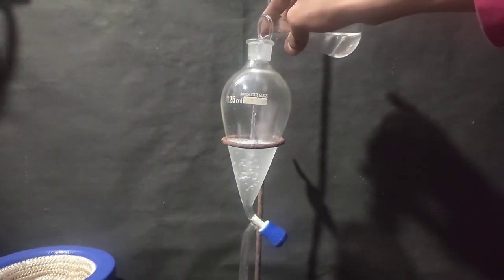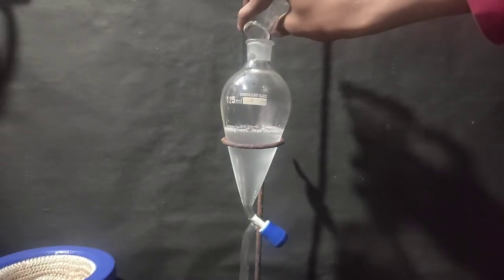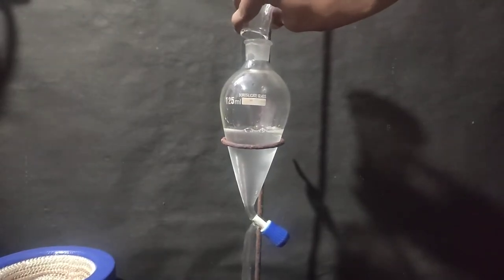Then this solution was poured into a separatory funnel to separate the oily layer from the lower aqueous layer.